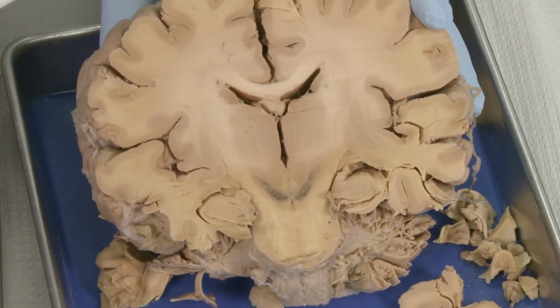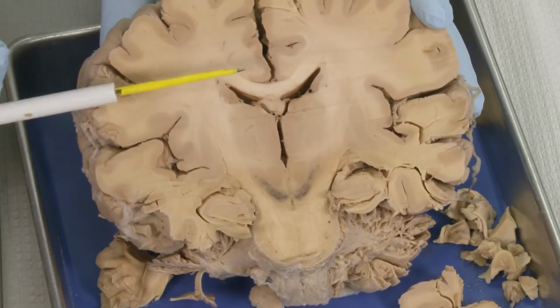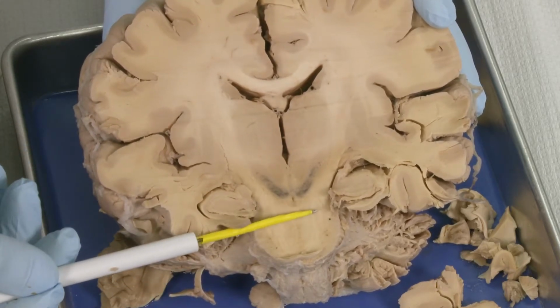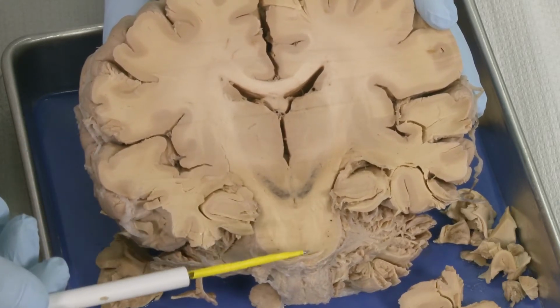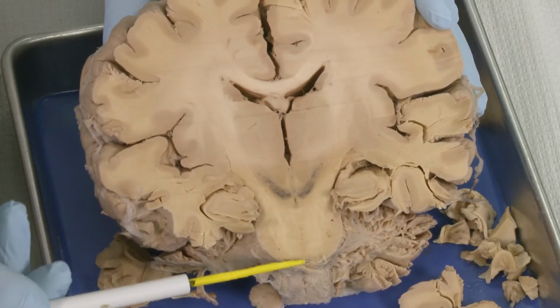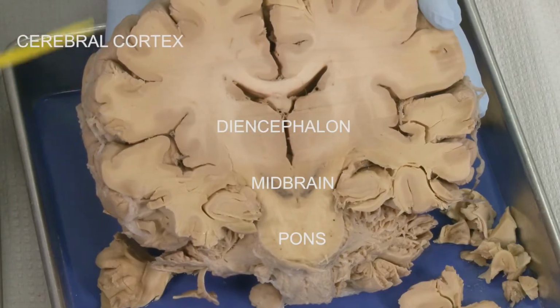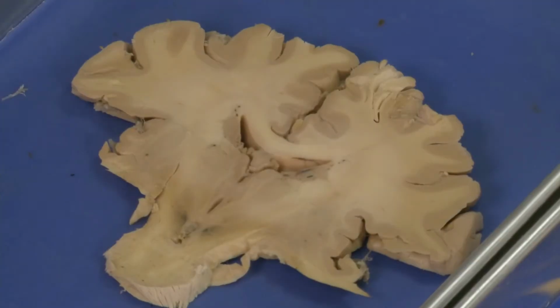So now you can see that we sectioned through the diencephalon, midbrain, and ventrally from the midbrain you have the pons. So you have here pons, midbrain, diencephalon, and then cerebral cortex. So this is the cut from the brain which I just showed you.